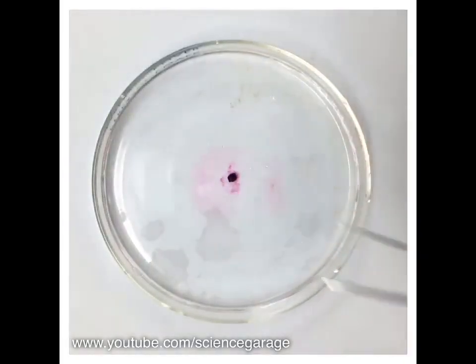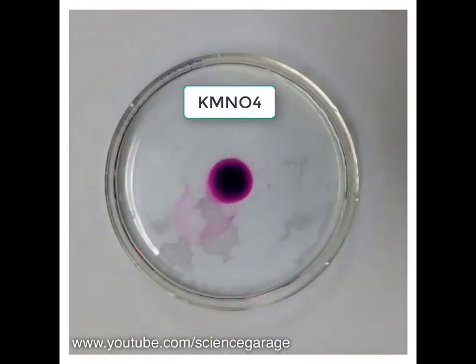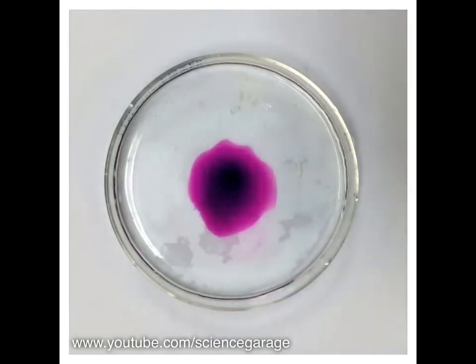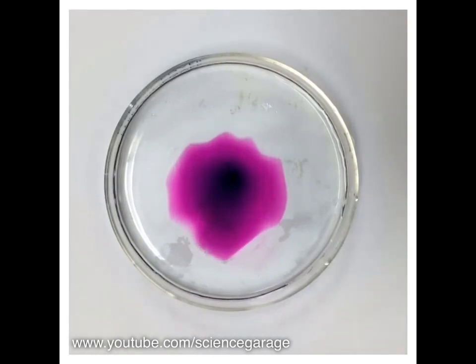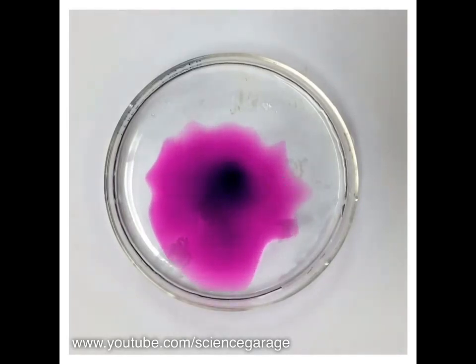Here the procedure of the experiment is shown. The procedure starts with the placement of one crystal of KMnO4 in the middle of the Petri dish containing water, that may be normal tap water, warm, or cold water. Immediately after placing, KMnO4 starts diffusing from the middle of the Petri dish towards the periphery. After every 1 minute, measure the diameter of the circle for the next 3 minutes and write the readings in the table provided. Repeat the same procedure with the other water temperatures.